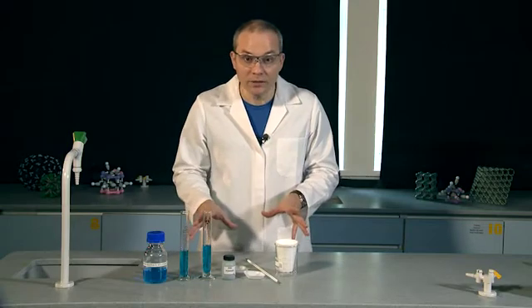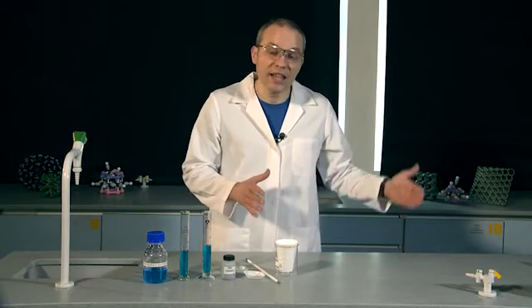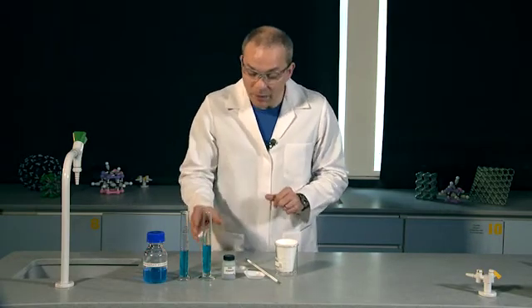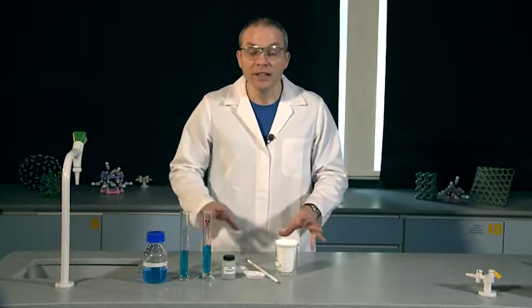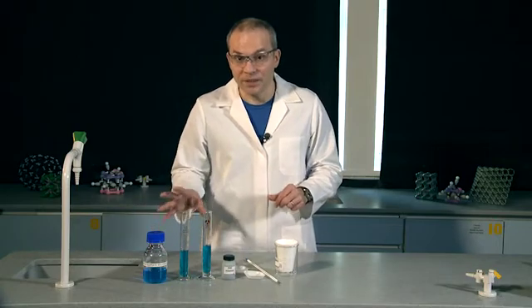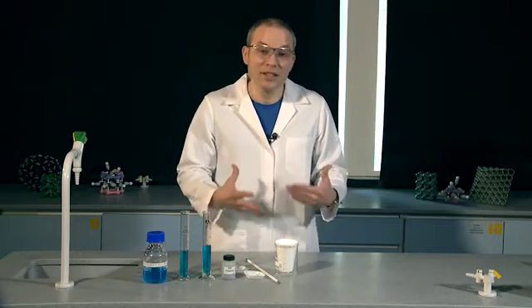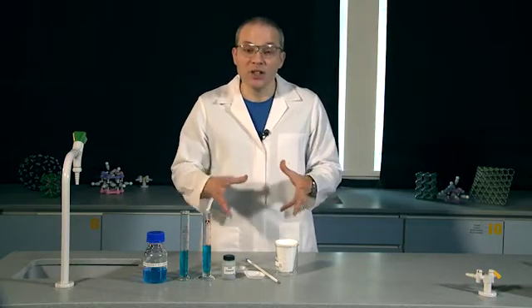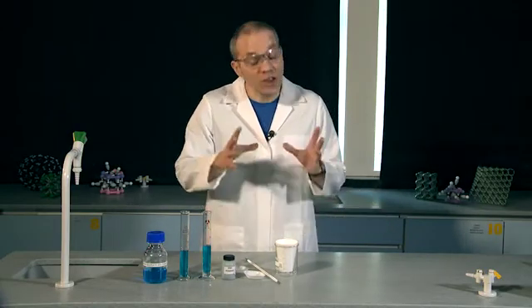If I control my variables well by measuring them, I should be able to repeat one experiment over and over and get the same result each time. In this investigation I'm going to use 30 centimetres cubed of one mole per decimetre cubed copper sulphate solution. Chemists measure amounts in moles and volumes in decimetres cubed — one decimetre cubed is one thousand centimetres cubed — so one mole per decimetre cubed is simply a measure of concentration.